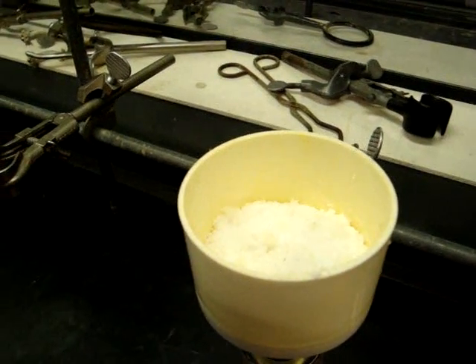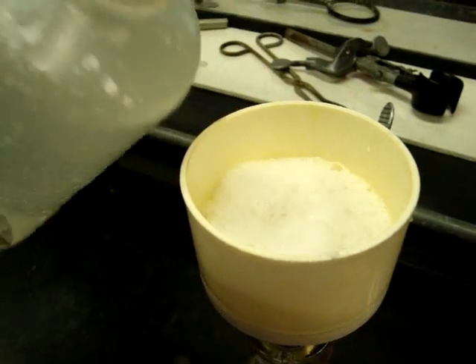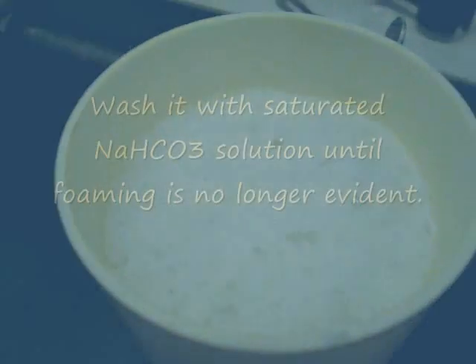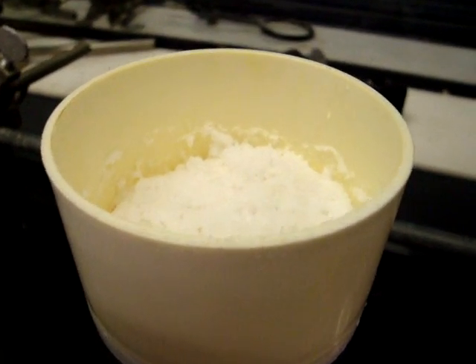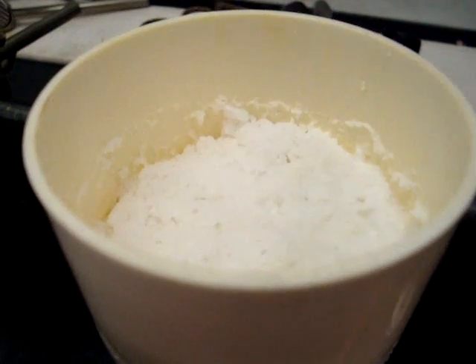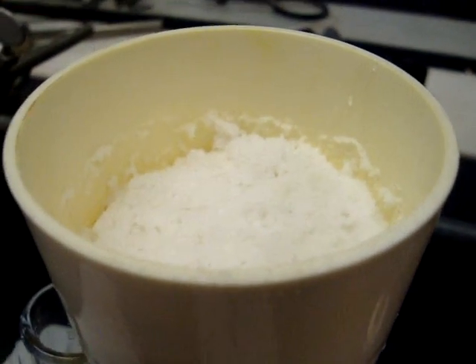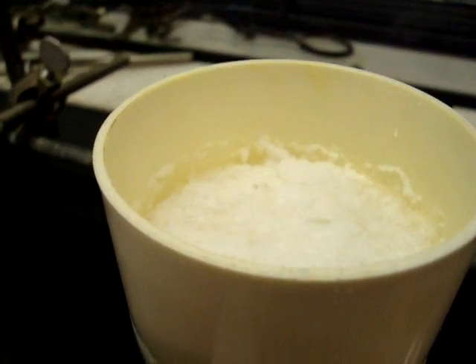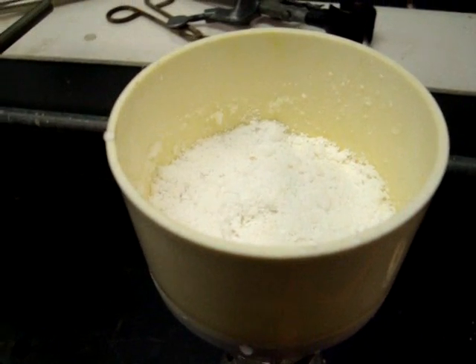Remember when washing your solid with sodium bicarbonate to turn off the vacuum when pouring in the sodium bicarbonate. As you can see, you will foam. Since the sodium bicarbonate will foam a lot, make sure you remove the water from the flask before pouring in bicarbonate. Wait until the product dries. You'll need to make sure you get all the material needed for this step. Once the product dries, you'll need to prepare 2,4-dinitrophenylhydrazone, a derivative of camphor.